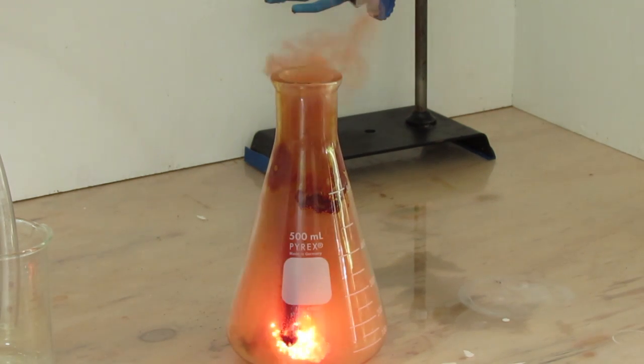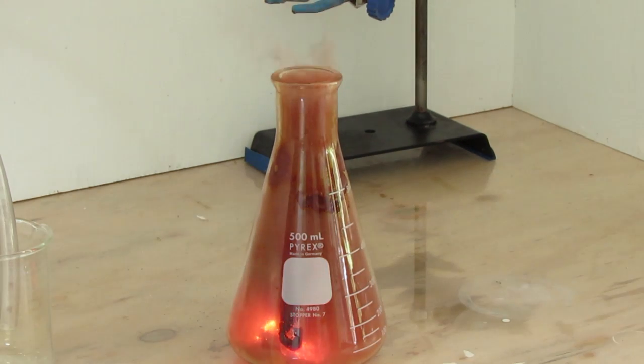Ok, that time I got it in there. You can see the heat produced really well, and you can see the red fumes coming out.